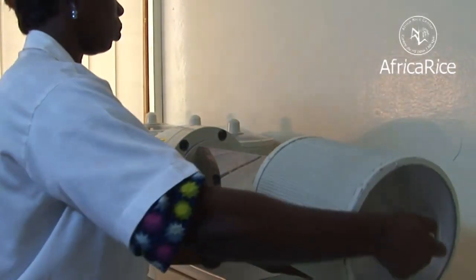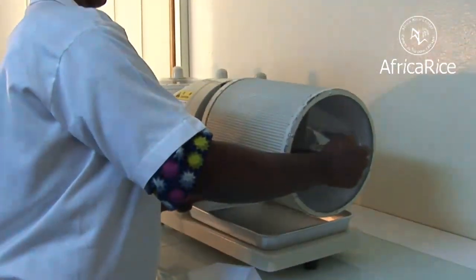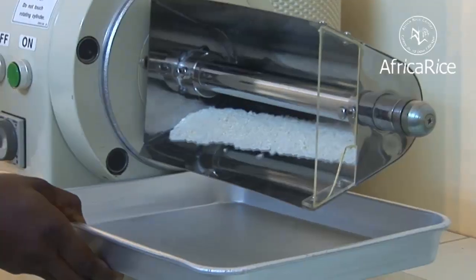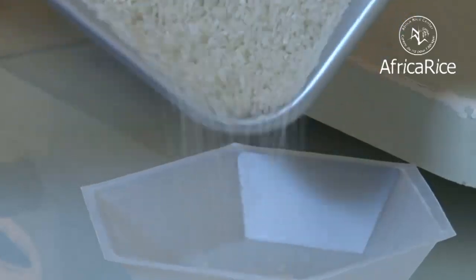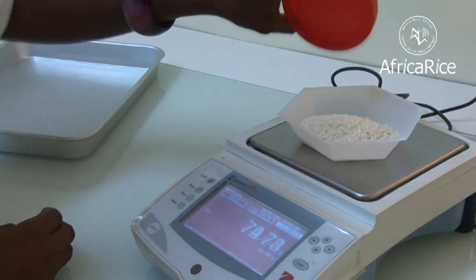During the milling process, some grains inevitably break, but the objective of rice milling is to reduce this to a minimum and to maximize the return of whole grains. A lab brokens separator is used to determine the level of brokens in a milled rice sample.